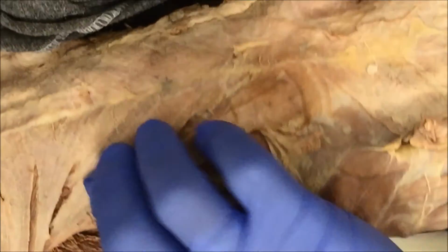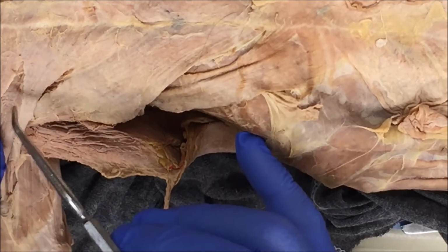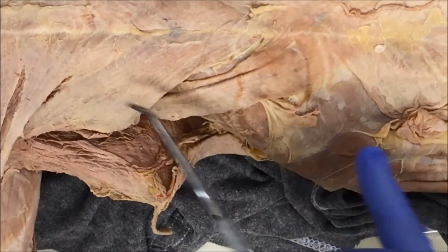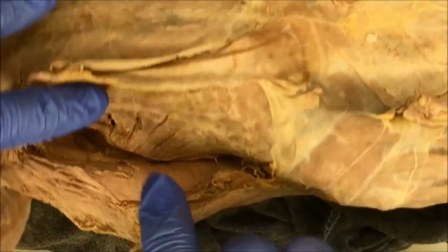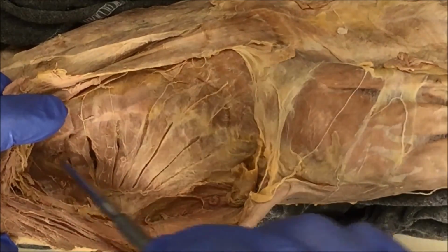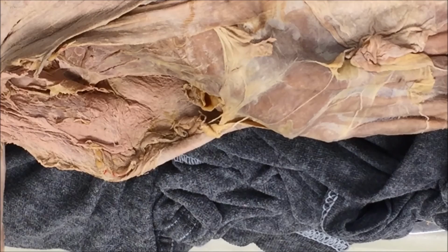All right. So one final recap of all the chest muscles. You have the pectoantebrachialis. Below the pectoantebrachialis, you have the pectoralis major. Below pec major, you have pectoralis minor. Below the pectoralis minor, you have the xiphihumeralis. And then when you reflect the latissimus dorsi and the chest muscles, you have this muscle here called the serratus ventralis. And this concludes the dissection of the muscles of the chest.